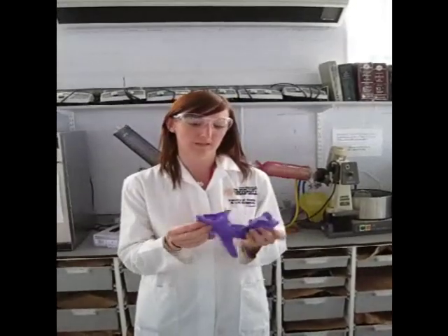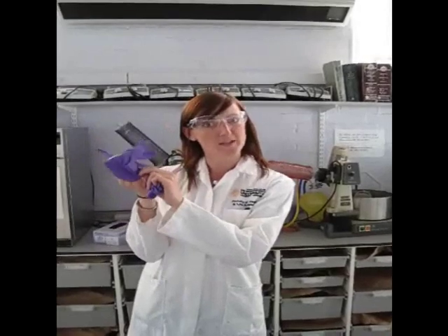Hello, welcome to DMU. Here at DMU we believe in safety first. Always wear your safety goggles students. Always have your lab coat done up. When using chemicals always wear gloves.